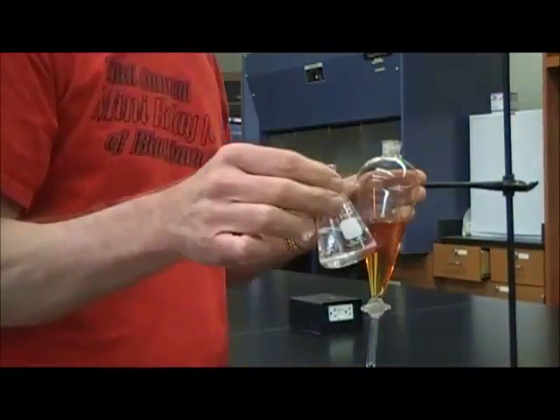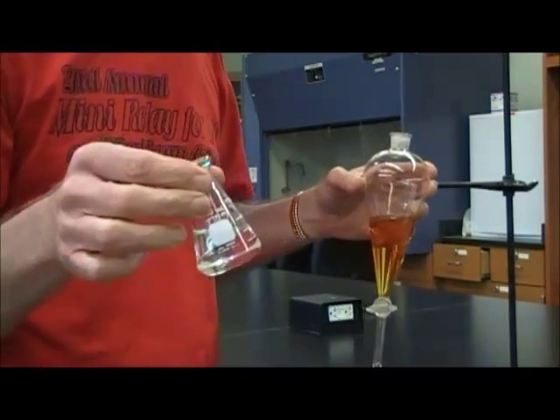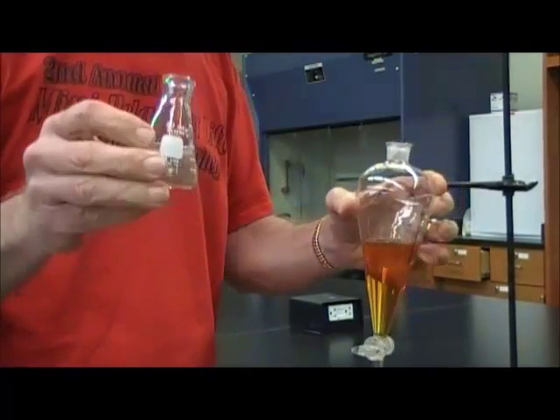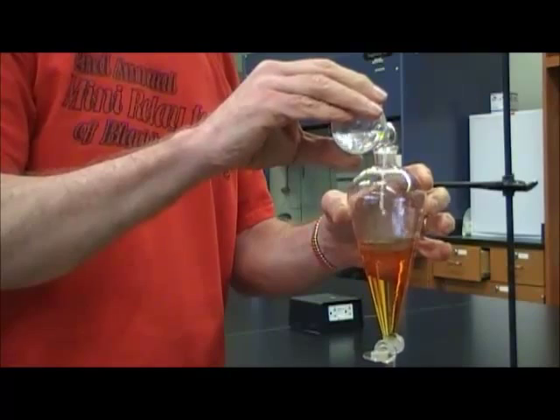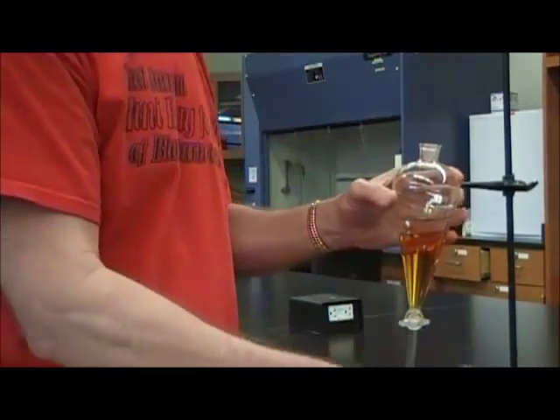And I'm going to extract it with a solvent called hexanes. It's just a non-polar solvent made of a mixture of alkanes. And I'm just going to pour it in on top. As it turns out, it's not soluble in water, and so it forms a separate layer on the top.